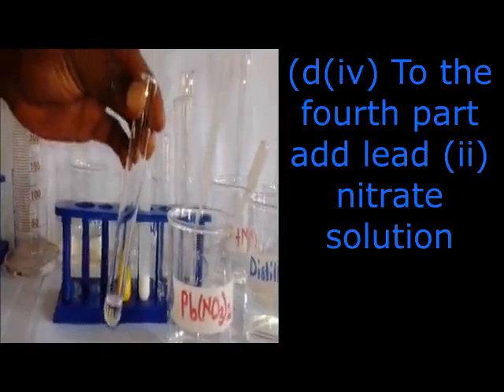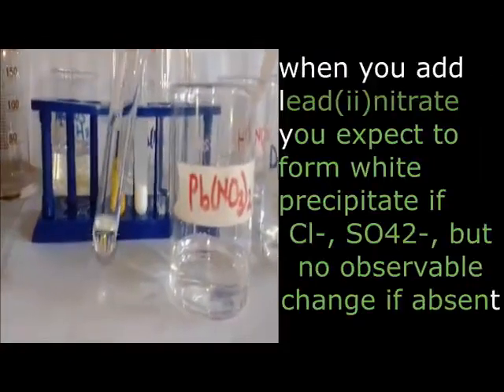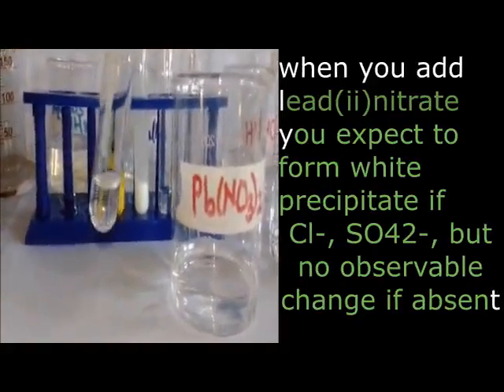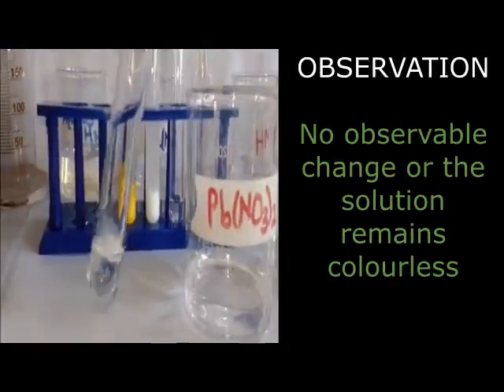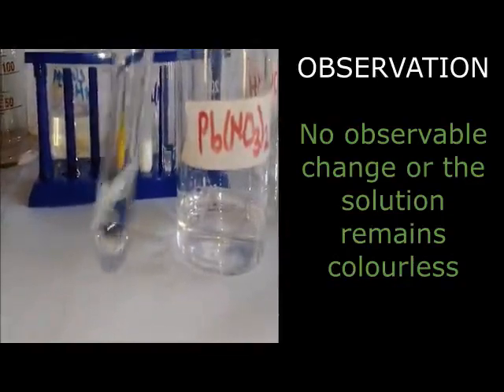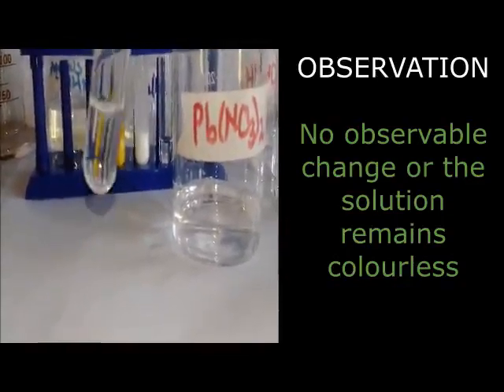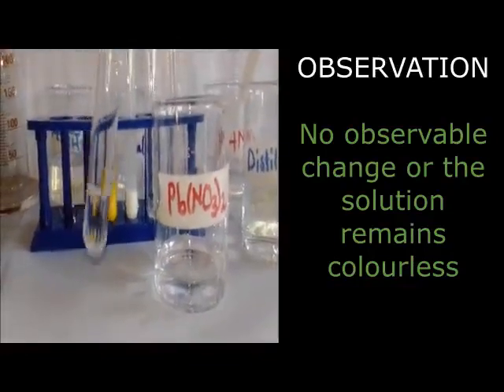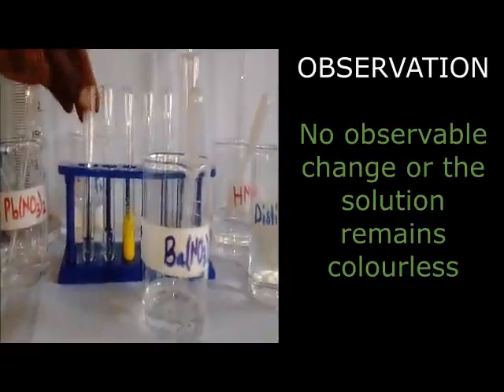Then our fourth test, they are telling us to add lead nitrate. So I go to my bottle of lead nitrate, I put it in my dropper, and I add. When you are doing the work, avoid interchanging the droppers. They add the first drop of lead nitrate, no observation. Add the second one, no observation. Add the third one, no observation. If I shake, nothing occurs.